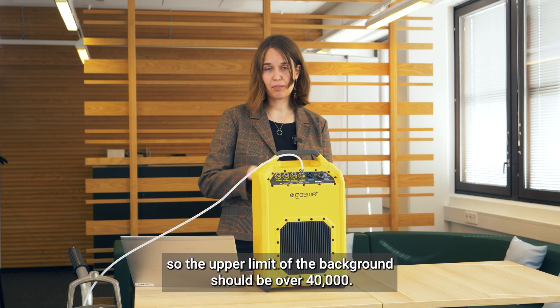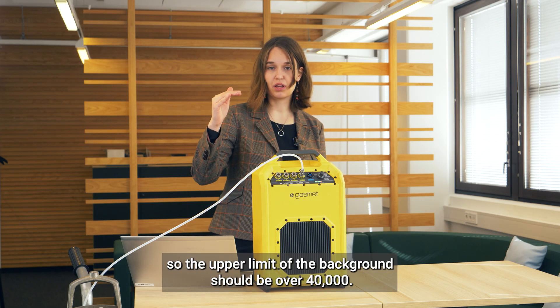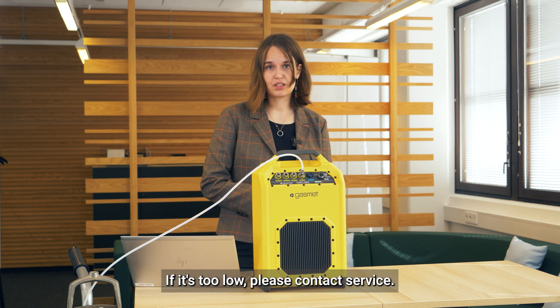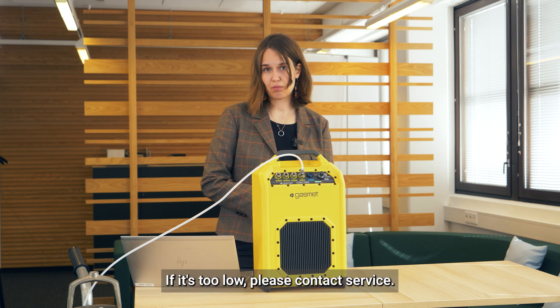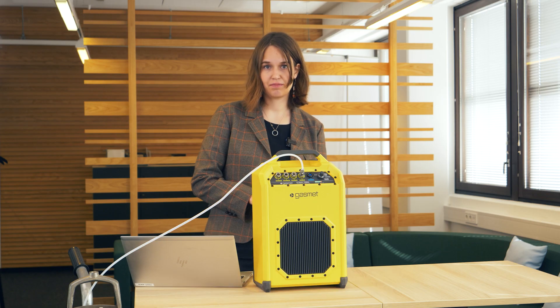You should also check that the level of the background is high enough. The upper limit of the background should be over 40,000. If it's too low, please contact service.